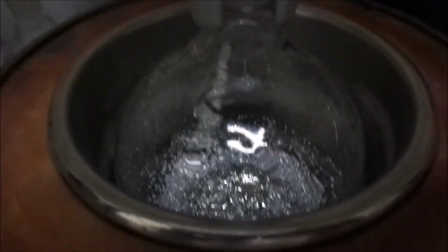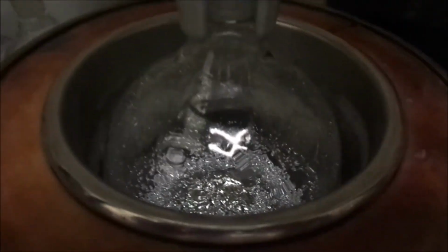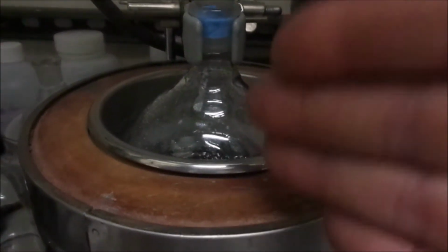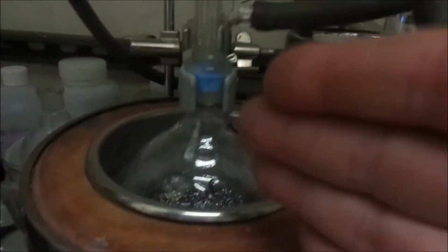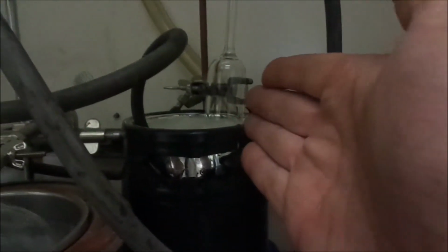See our mercury, it's freezing because it's in our cold bath, which is dry ice mixed with ethanol. It's at -78°C. The reason for doing that is, of course, to trap any mercury vapors that might happen to make it through all this down into here. And then as a redundancy, we have an additional cold trap, which was actually a bubbler, but it works just as well as a cold trap, down to the pumps, their filters, and all that.